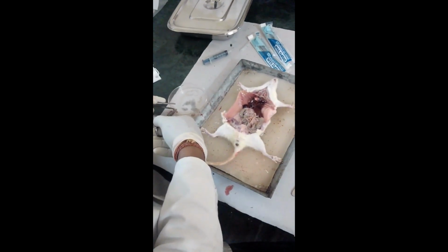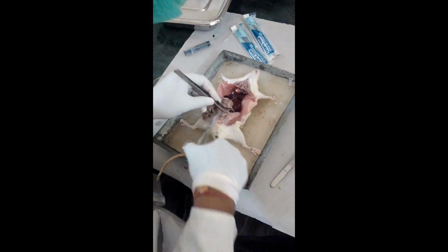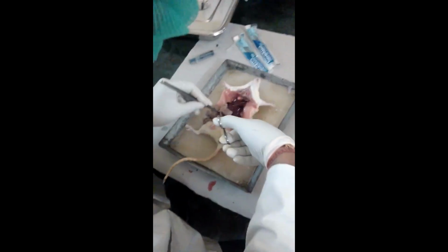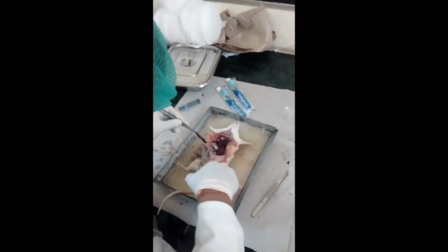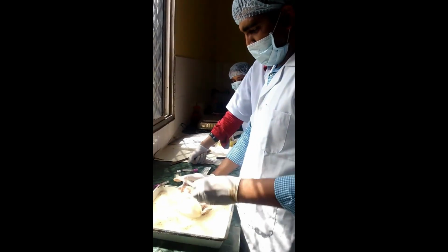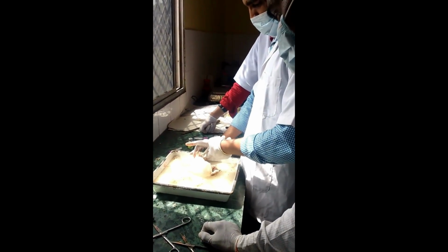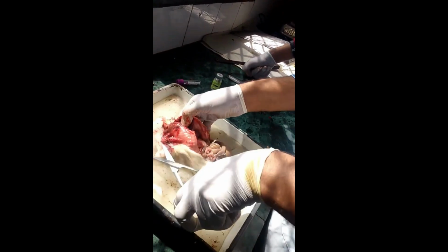Second, identify the spleen. Here you can see, this is the spleen. You have to remove the fatty materials around it carefully. Next, remove the kidney. It is in the same place where the adrenal gland was available. So you have to remove both the left and right kidneys.